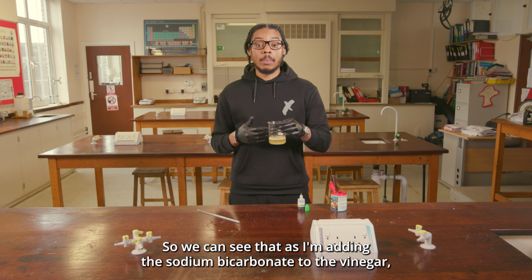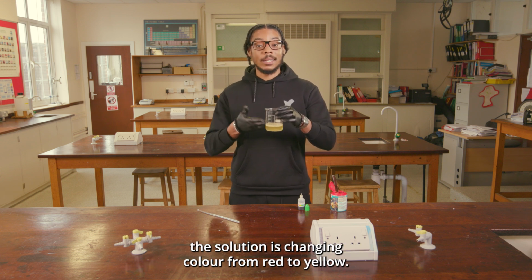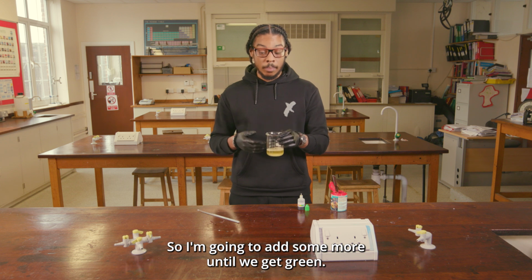Right, so we can see that as I'm adding the sodium bicarbonate to the vinegar, the solution is changing colour from red to yellow, and that's because the pH is increasing and the solution is becoming neutralised. So I'm going to add some more until we get green.